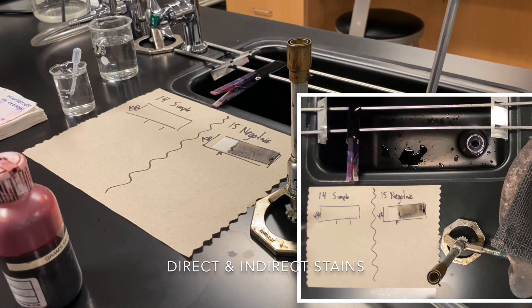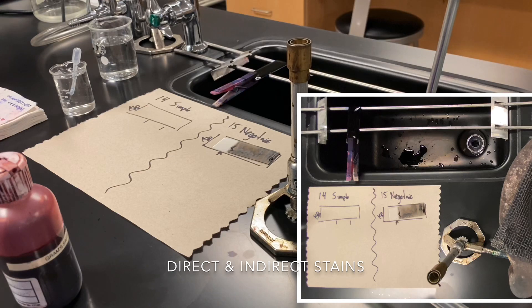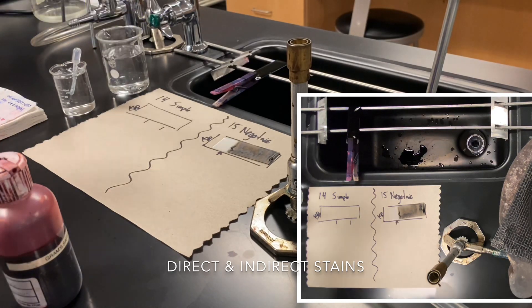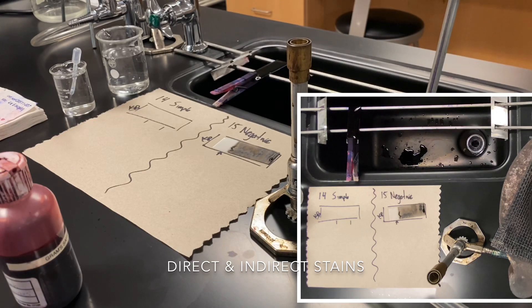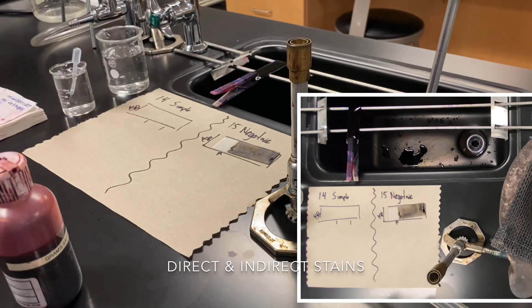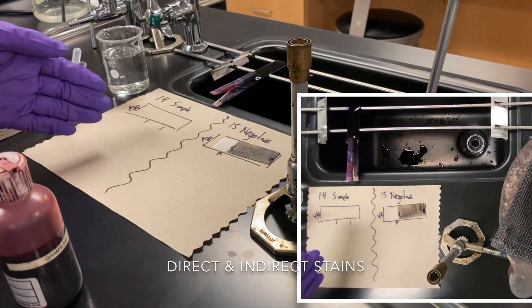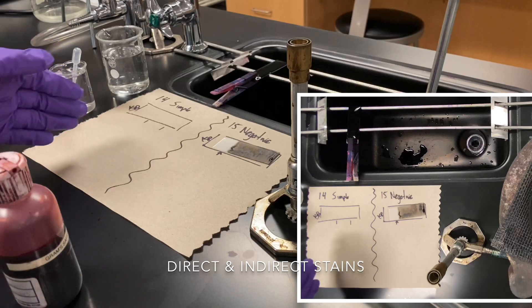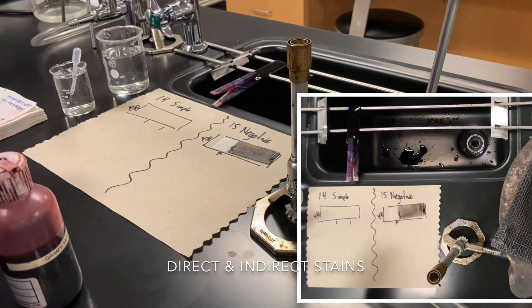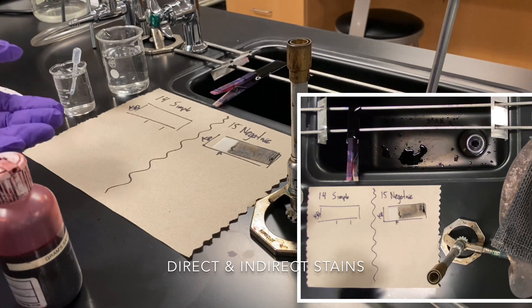While we continue to wait the minute for methylene blue, I already have water ready to rinse it out. Once the minute is over, we'll rinse that slide out and proceed to stain the negative stain slide, which should be mostly dry by that point. Our simple stain, Lab 14, is just a smear and then one minute of methylene blue — that's it. The simplest, hence the term, simple stain.